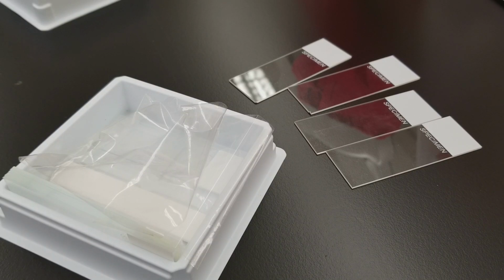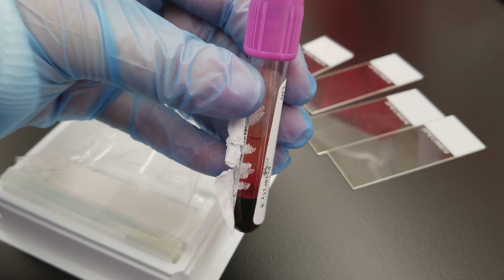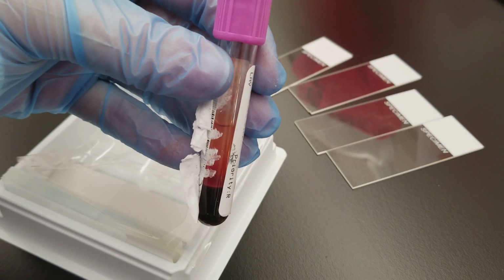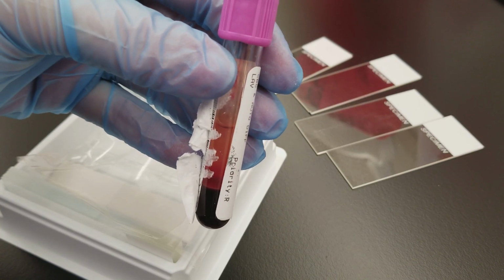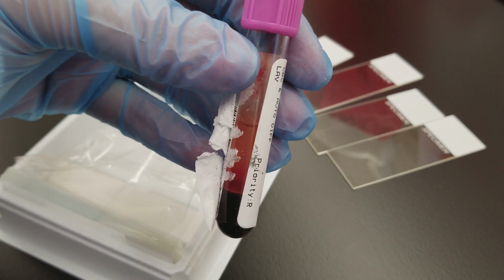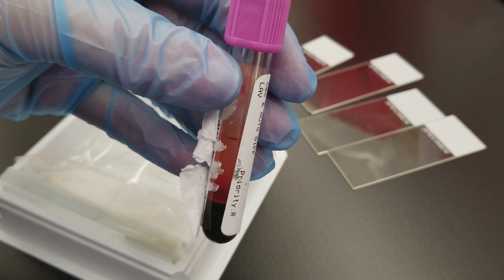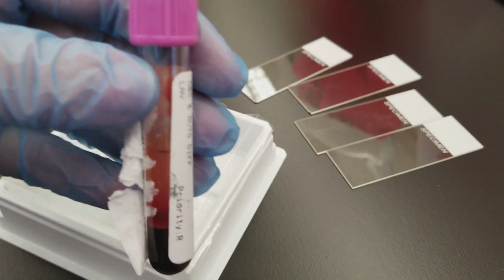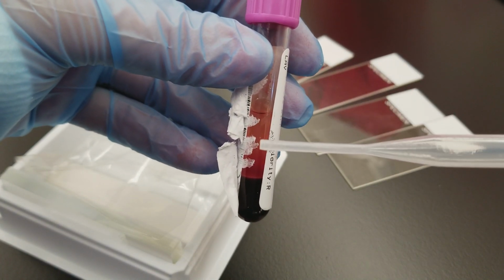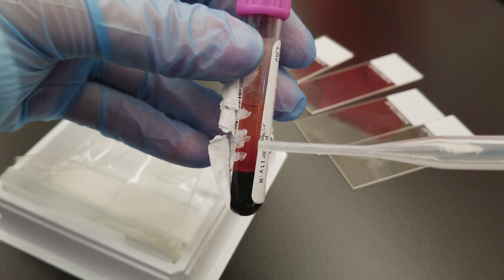So first thing I want to show you is my specimen. It's a purple top known as an EDTA tube. It's potassium EDTA. If you don't know much about that tube, please see the phlebotomy video about the different blood draw tubes. Now, what you want to see here is that the plasma is actually a really nice color. I'm going to pull it up so you can see it.